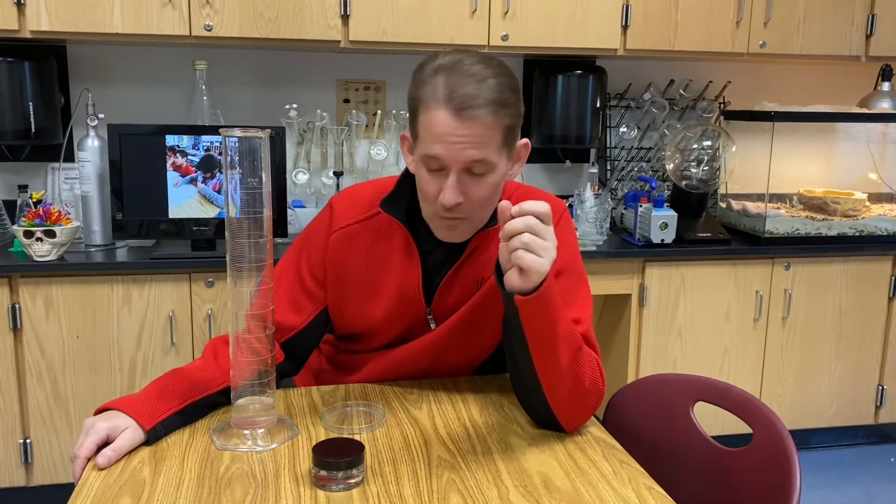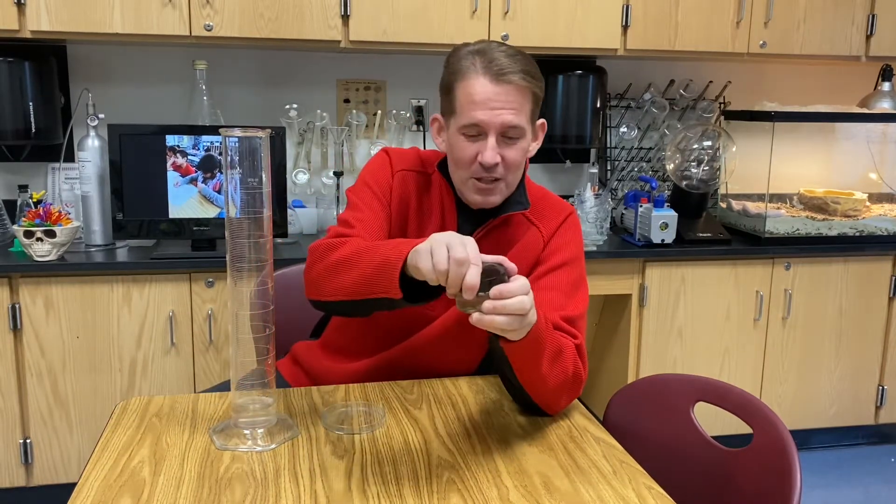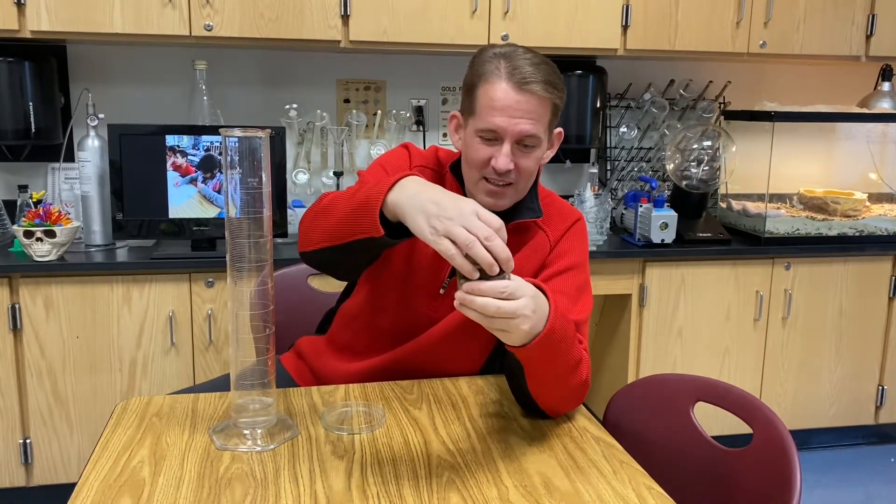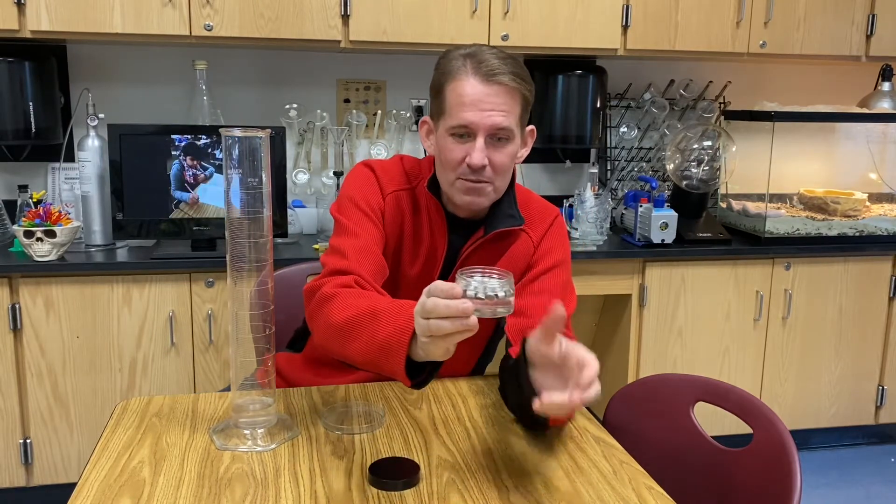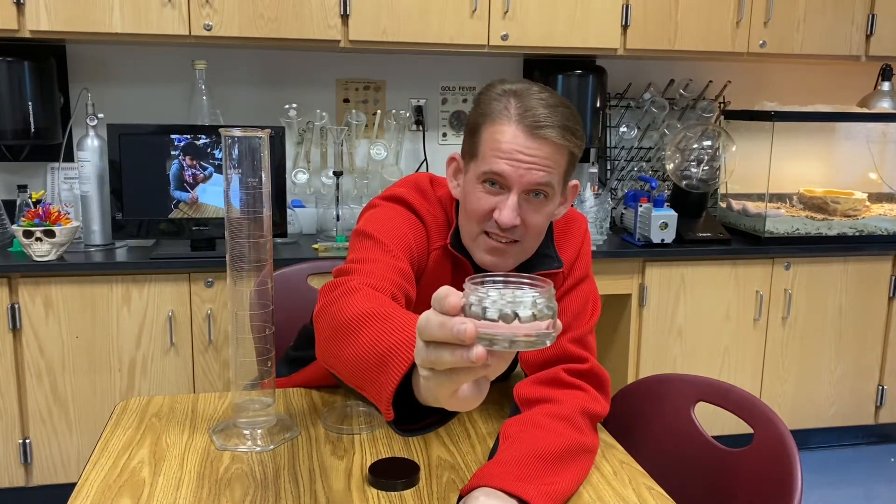Welcome back to Ramsey Land. Today we're gonna do a single displacement reaction with lithium and water. This is what elemental lithium looks like. I like to store it in mineral oil because it's very reactive with water and oxygen.